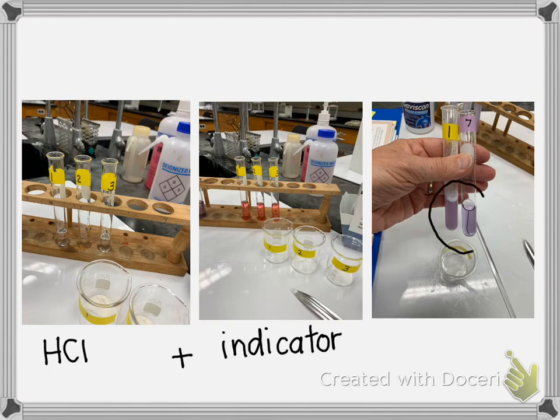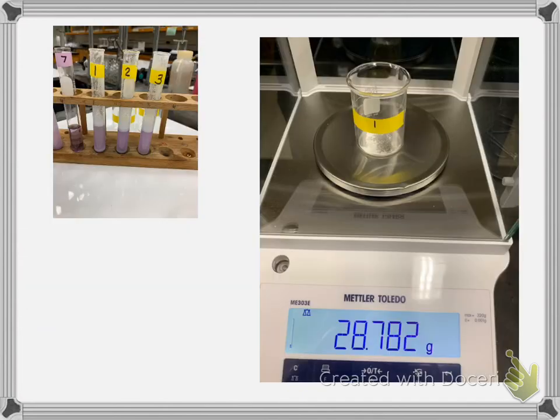You can see I kept adding antacid and stirring. This one didn't look quite as chalky as the Gaviscon, and I don't know why, but it still wasn't clear like the pH of a 7. So I neutralized it all, and there you can see in this picture I had all 3 samples I was working with. I guess I was being an overachiever that day.